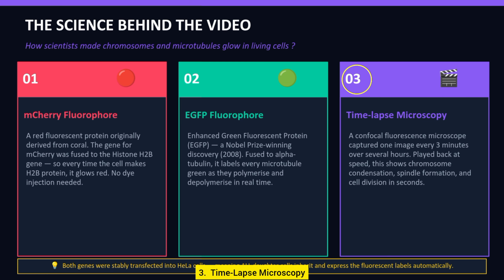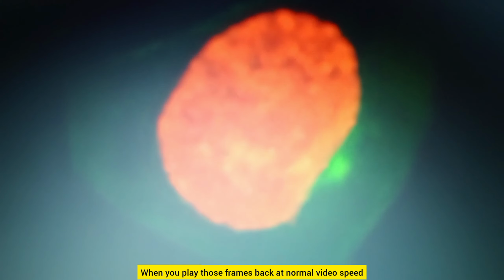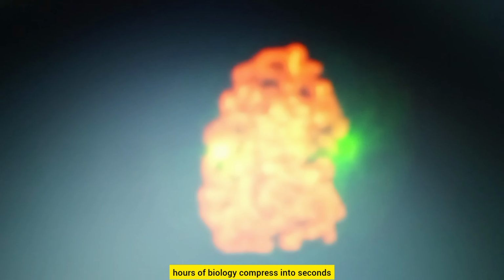Technique number 3, time-lapse microscopy. A confocal fluorescence microscope photographed the cell once every 3 minutes, over several hours. When you play those frames back at normal video speed, hours of biology compress into seconds.